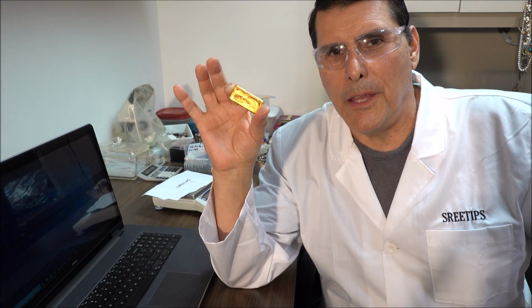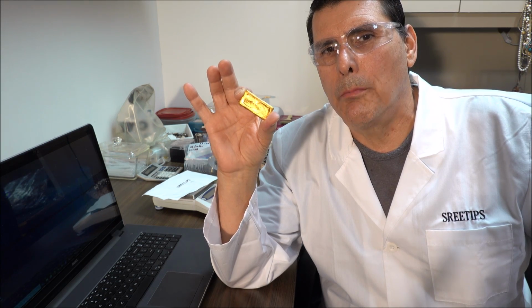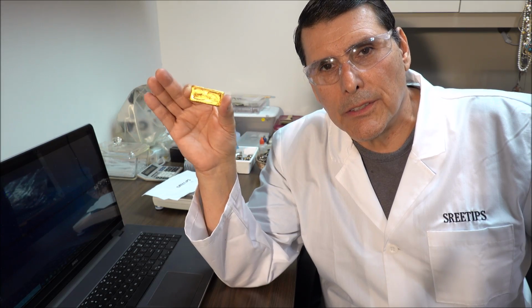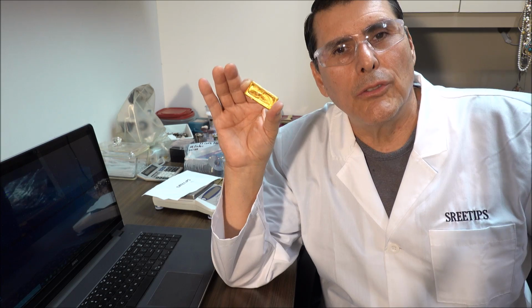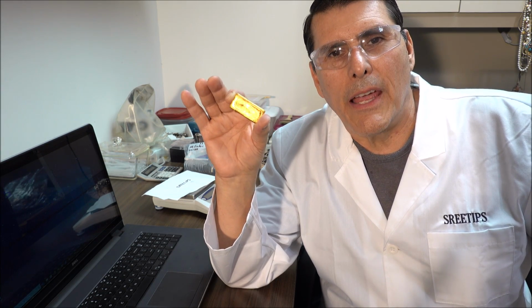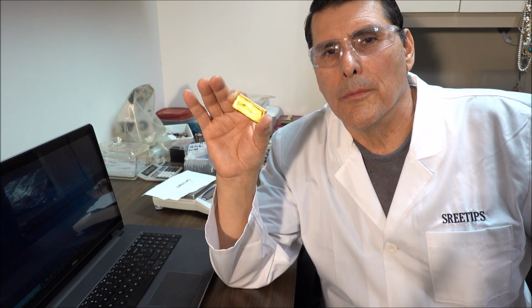This will conclude the video. I've got my 3.3 troy ounce bar here. I did not do a second refining because this is going to go into the refiner, the big refiner I sell to, and he'll just throw it in with his next batch and re-refine it. So there's no need to go with high purity here.